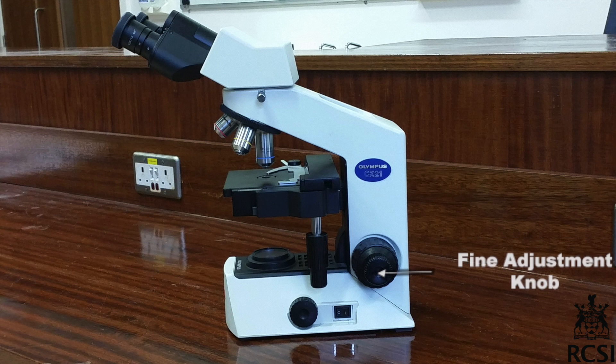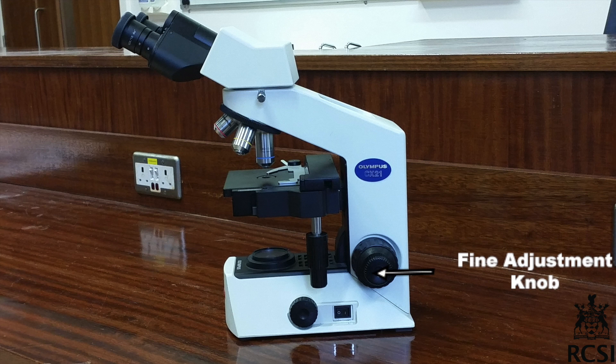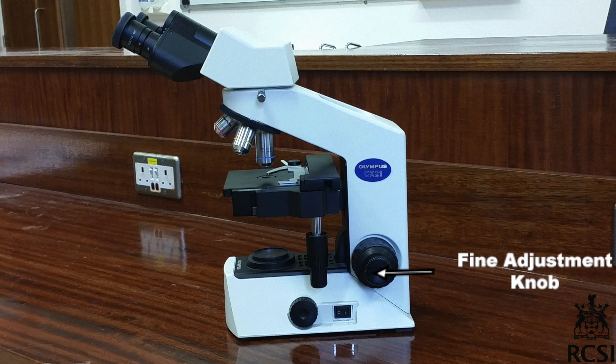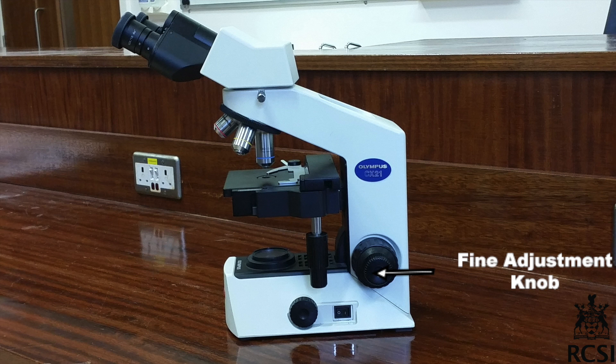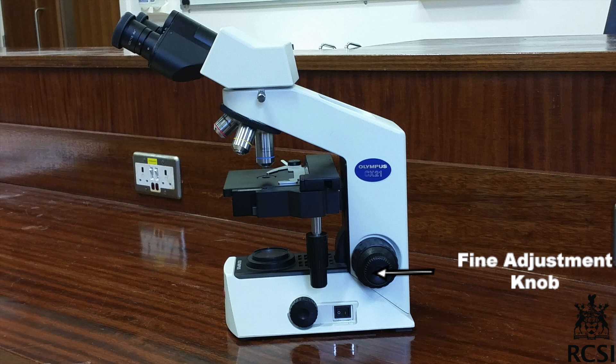The fine adjustment knob is a smaller round knob located in the middle of the coarse adjustment knob. It is used to fine-tune the focus of your slide after using the coarse knob.